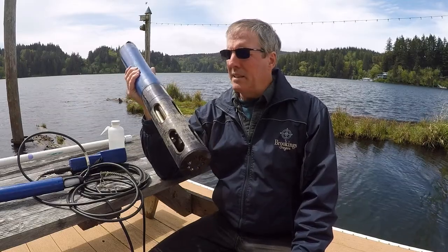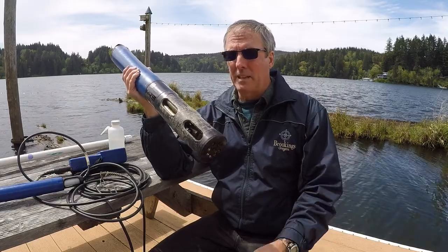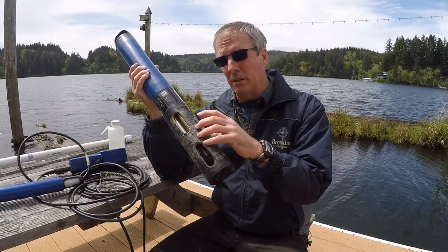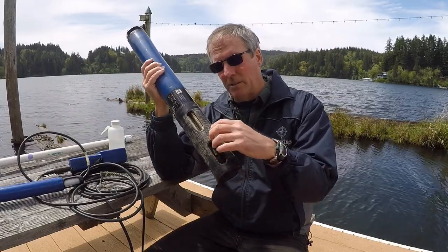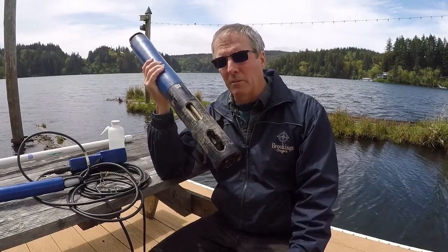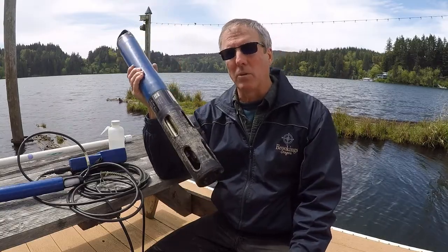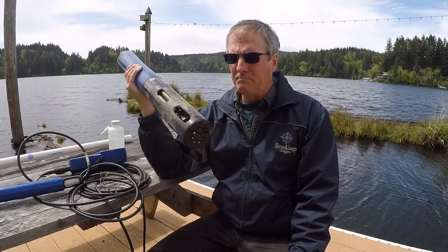For calibrating, these, especially the older ones, were really complex. When you're doing your pH probe, we had to put the pH solution just over the pH probe and then take the reading on that while trying to balance that, or have this in some kind of a stand to hold it up, and it was just kind of a hassle.